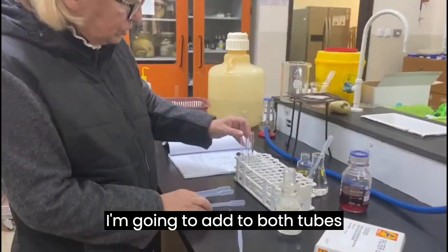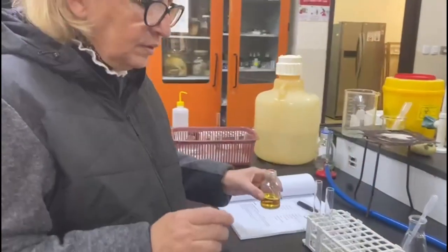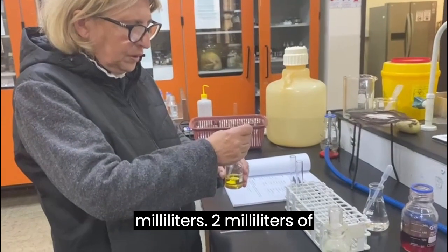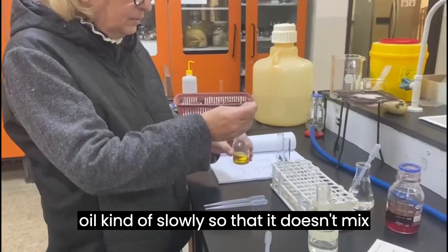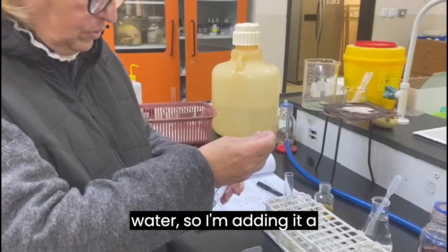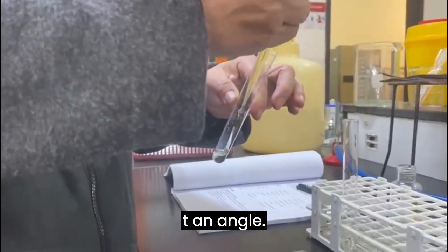I'm going to add to both tubes oil, corn oil, same amount, 2 milliliters of corn oil. I want to add the corn oil kind of slowly so that it doesn't mix with the water. So I'm adding it at an angle.